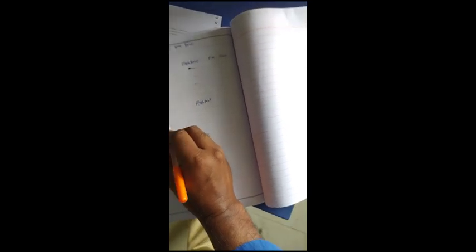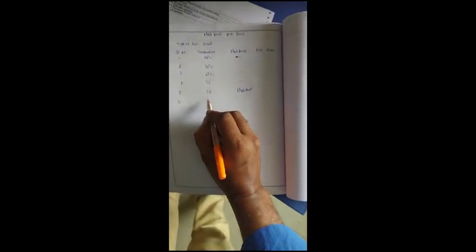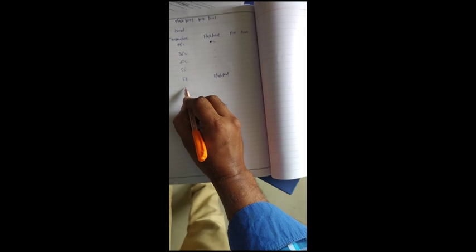Again we are doing this experiment. It shows 65 degrees Celsius. There will be a fire point. So now the reading is: flash point of the diesel is 58 and the fire point is 65. So this is a very simple experiment. Thank you.